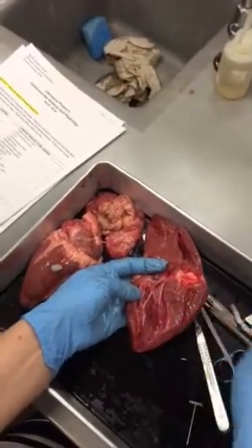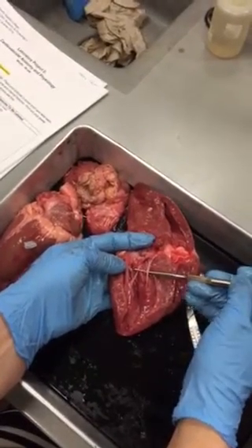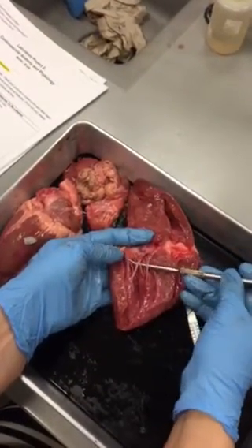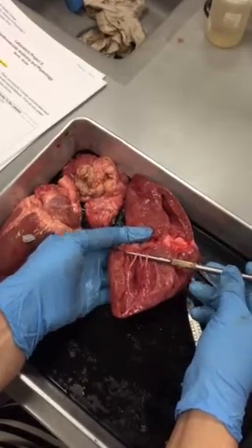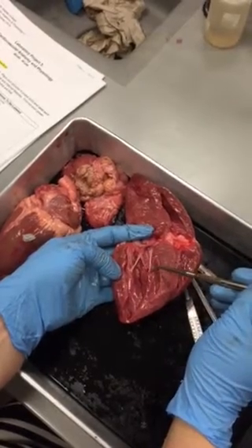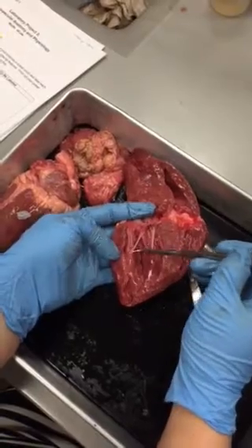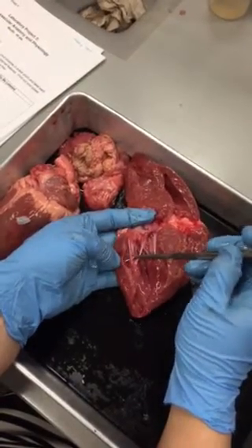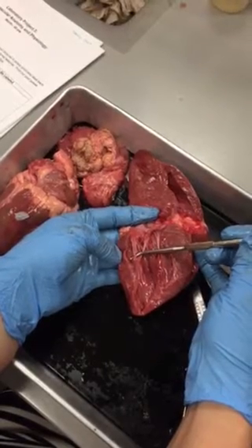You can also see in here, we have our chordae tendineae, however you want to say it, to remember how to spell it. Make sure you don't leave out letters, spelling counts, right? These are attached to little muscles that are kind of like little bumps here. This is a good one right here. These are your papillary muscles. Okay?